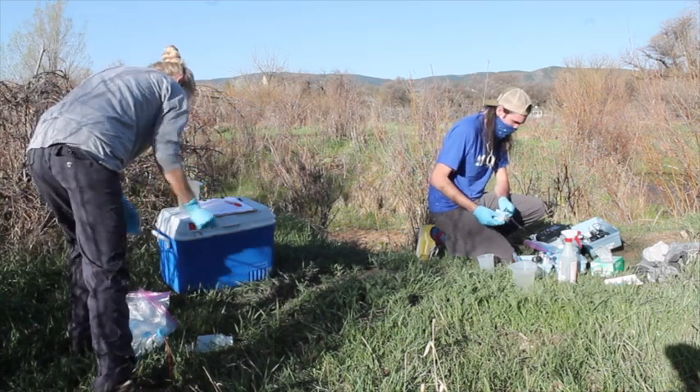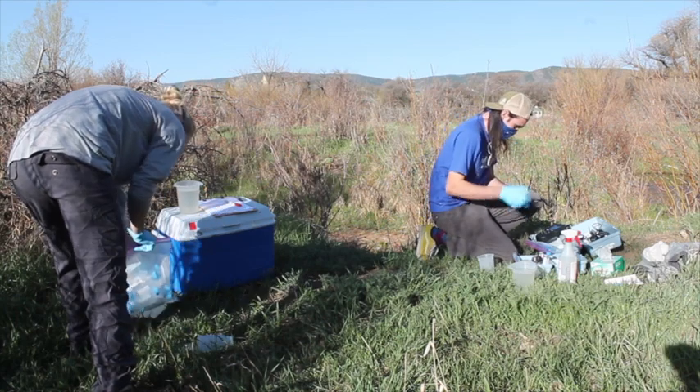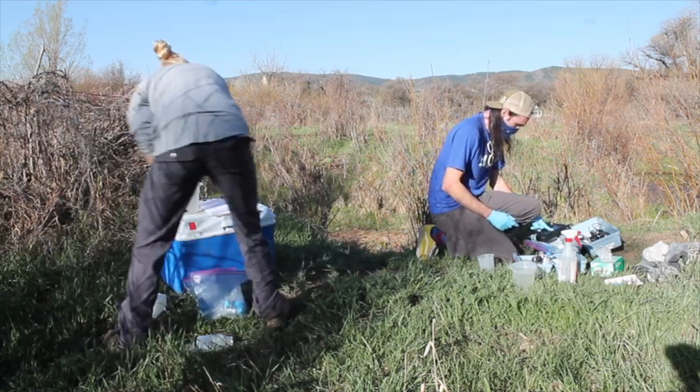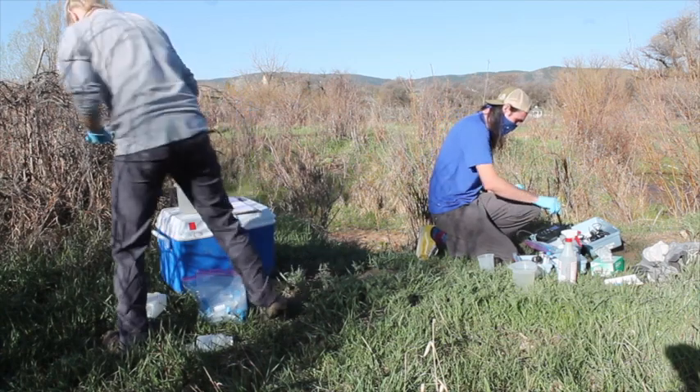What I'm doing right now is just calibrating the pH probe, checking the display and making sure we get good results. We're starting with pH 4 — you guys have all done this already, so I'm sure you know what I'm talking about.